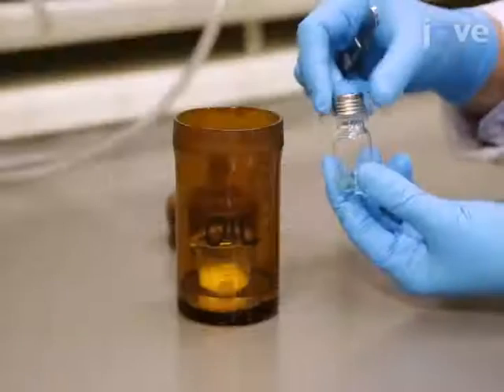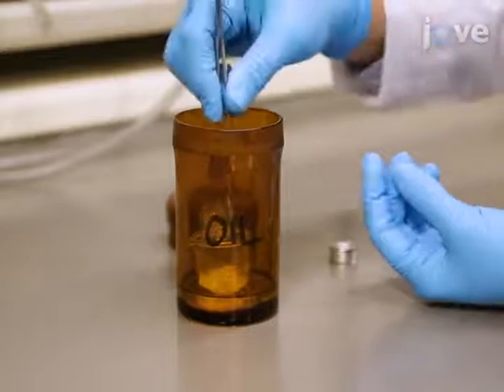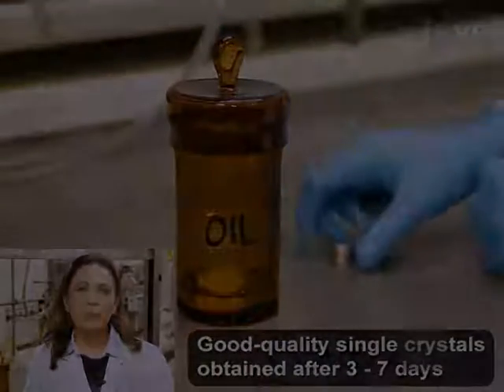Then, place the vial in a jar filled with paraffin oil and let the solvent diffuse slowly in the oil at room temperature. It remains challenging to anticipate the composition.